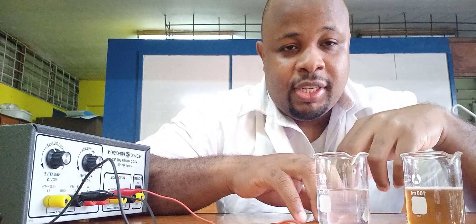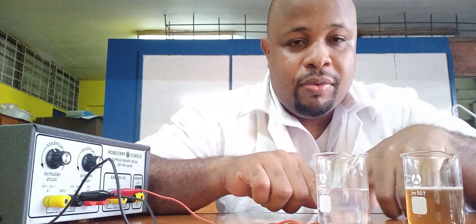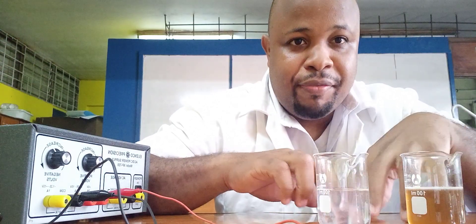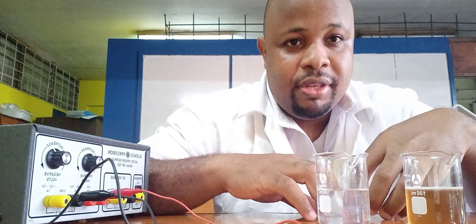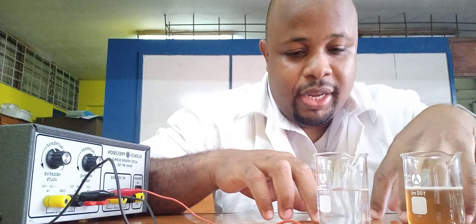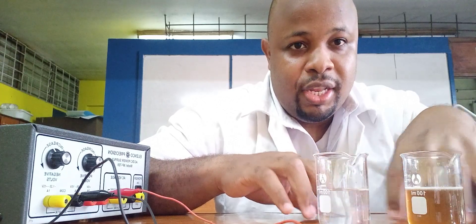Electrolysis is the decomposition of an electrolyte when we pass an electric current through it. For our experiment, if decomposition is taking place, we will have the anode and the cathode, so we need to see a reaction occurring at either of those electrodes. Most likely, what we are looking for is the production of bubbles around the electrodes.